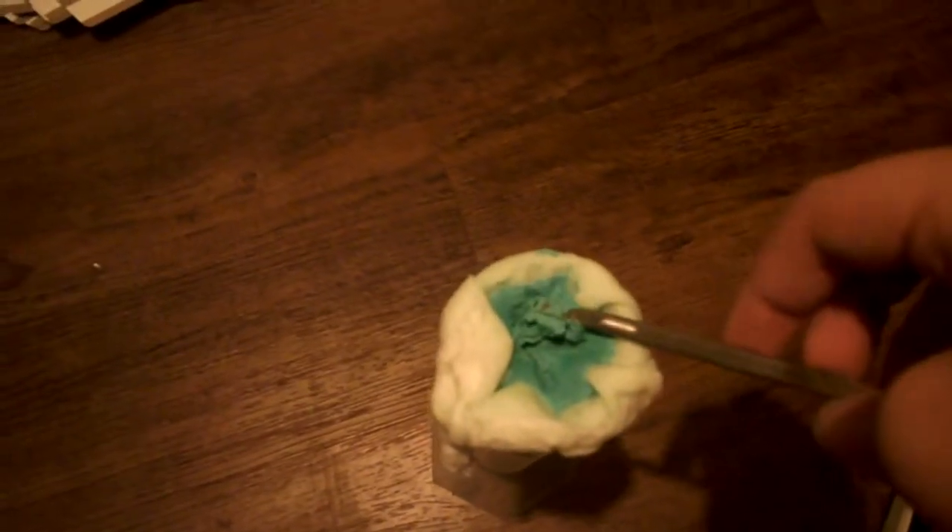It's kind of crude, but it looks pretty cool. I'll put that into my drying paper. Here I have my precipitate paste — it's really thick. Being a good chef, I always have a prepared sample. So that's the dried product inside of a vial. It's really quite nice.